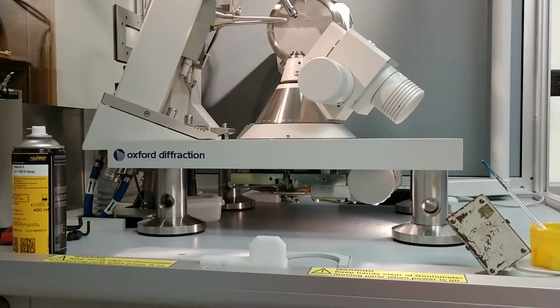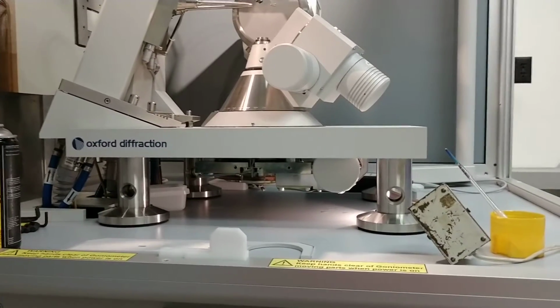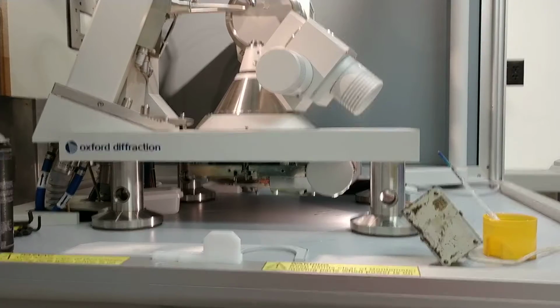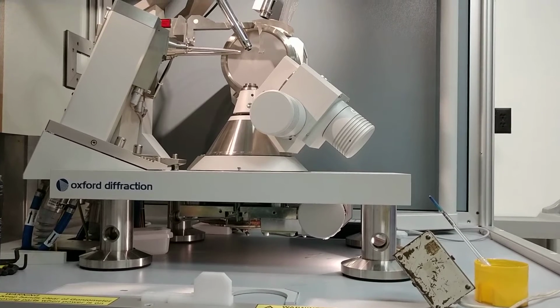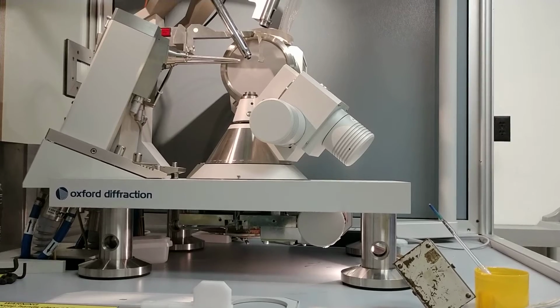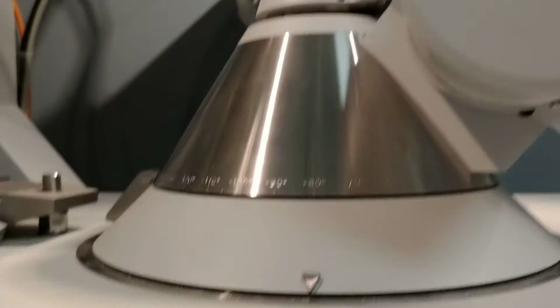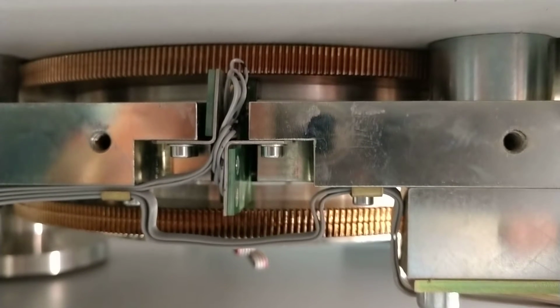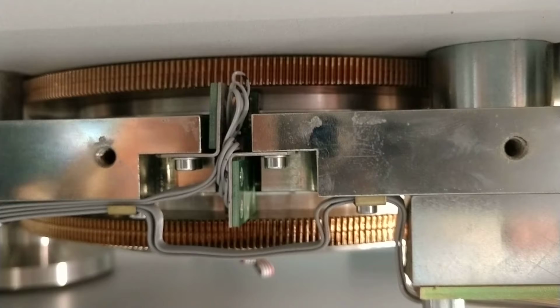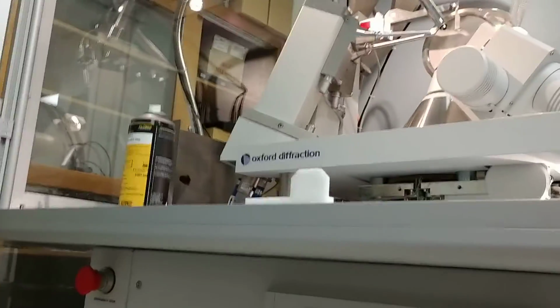It was not allowed. Minus 170 was not allowed. I'll do 160. Nope. We'll do 155. Okay. Yes. DTO minus 160. Okay. I'll do 155. See what happens. A little bit. Okay, you want me to get, I'm going to zero.